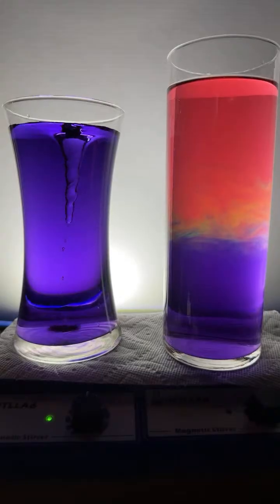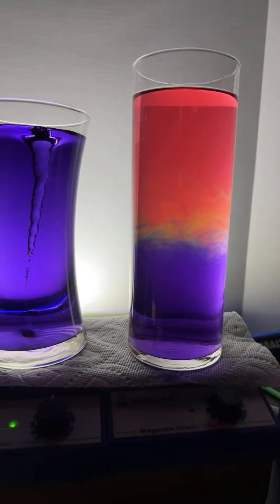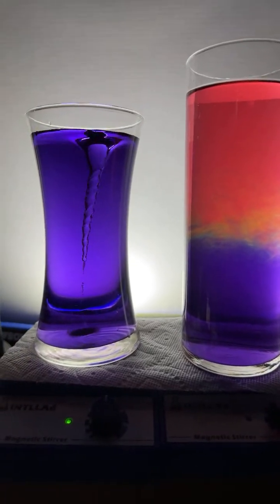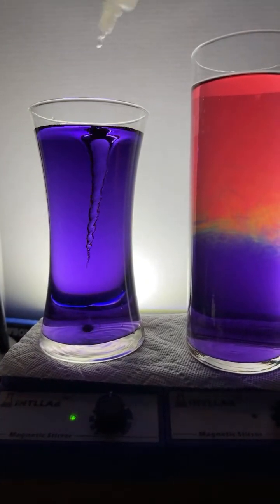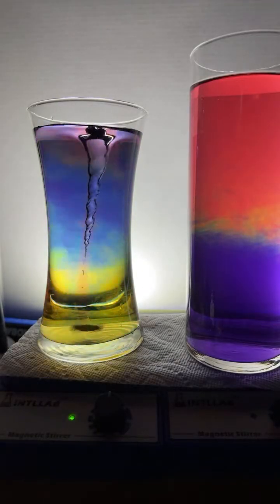Anything solid in my arsenal? Hey, check it out, man. We're starting to get the pH gradient going here. So long, Nova. Thanks for joining in. Great having you. Nilo, I'm not going to be dipping my finger in there. It's not good practice. But nothing would happen.